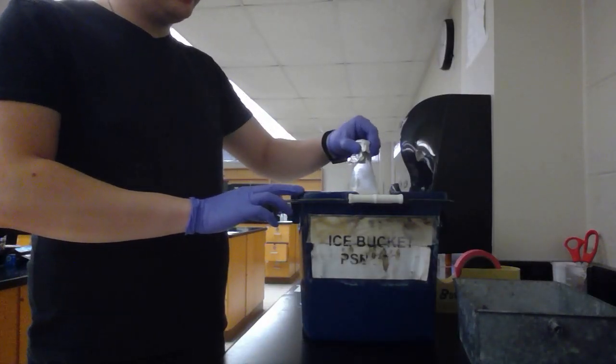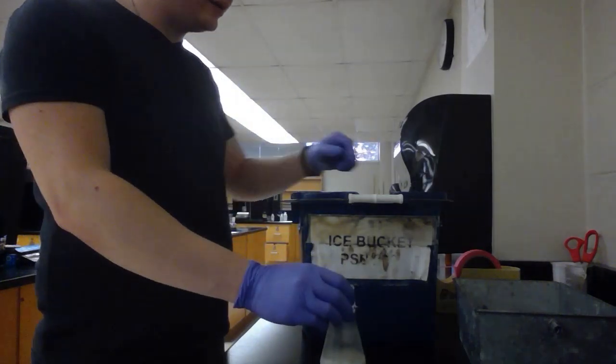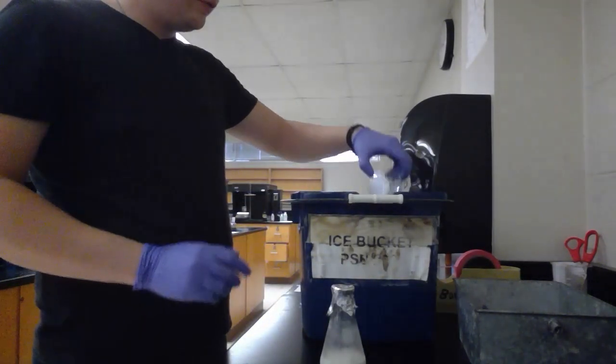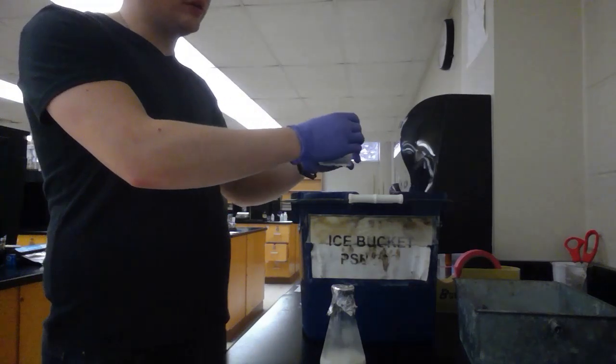So we have the soap in the ice bath. And we're going to add 50 milliliters of saturated sodium chloride solution.